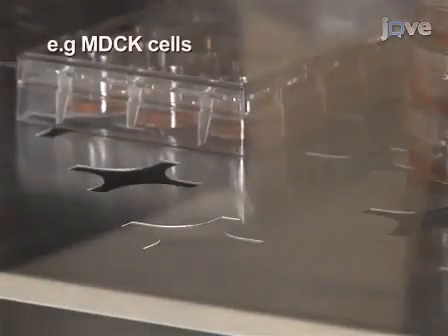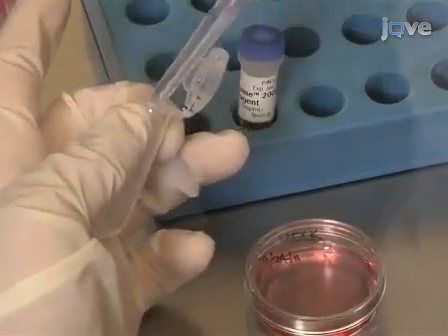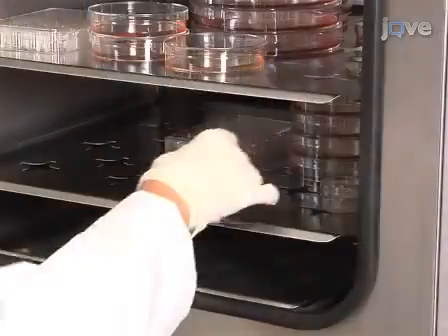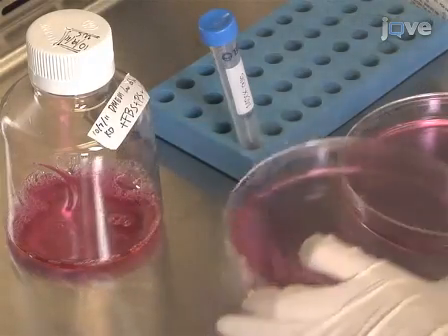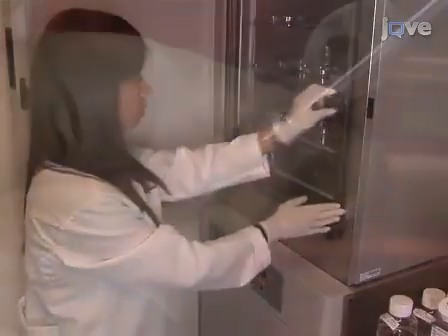In a P35 dish, culture cells at 80 to 90% confluency. Transfect the cells with the plasmid of interest using Lipofectamine 2000, as per manufacturer's instructions. Then place the cells in an incubator. On the next day, split the cells into two P150 Petri dishes and incubate overnight.